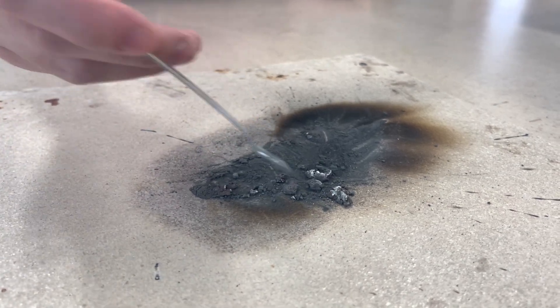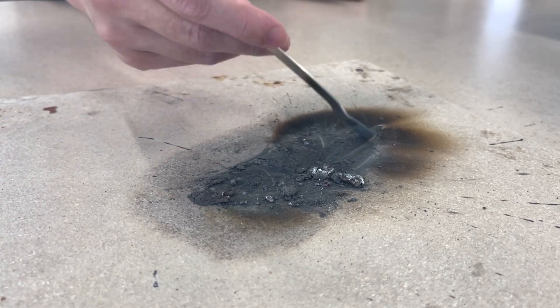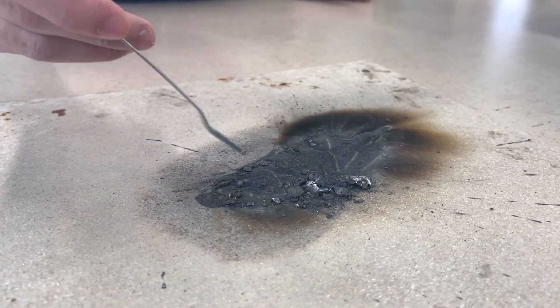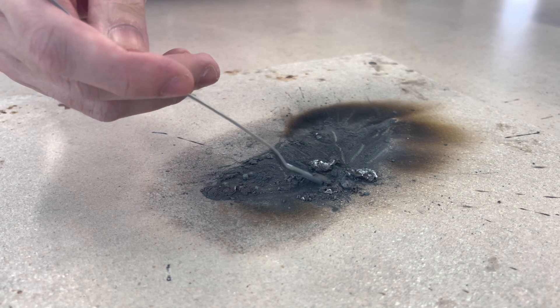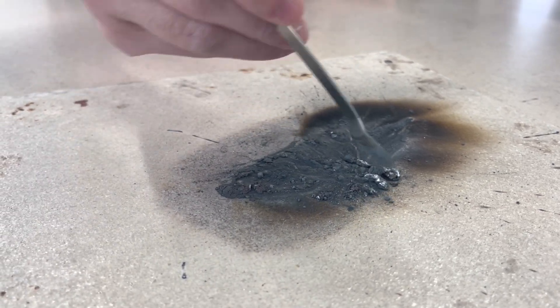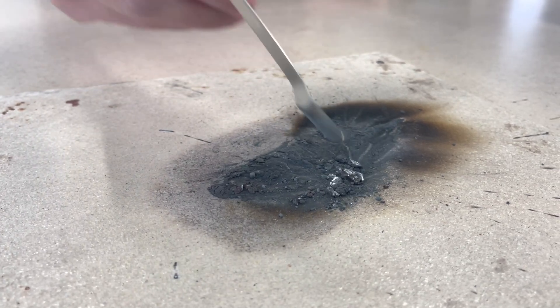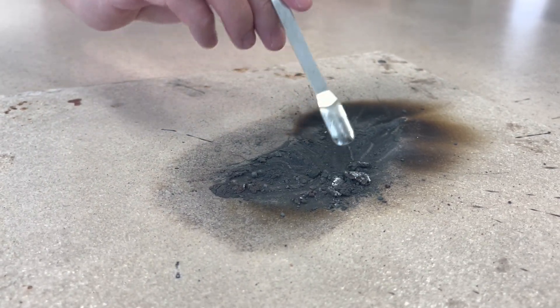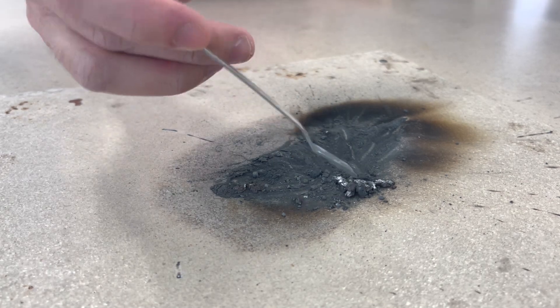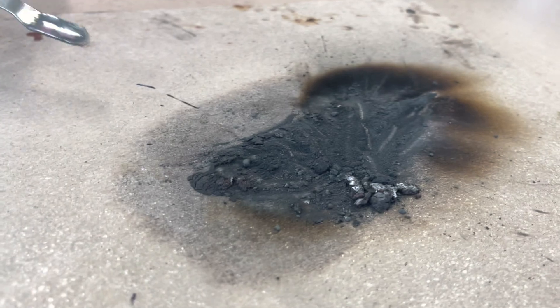So what are they? Can you think of what they are? You can also see that all the black copper(II) oxide has disappeared, but there is some reddish-brown residue over there. Right now you can observe there is some reddish-brown solid as well as some white solid here.